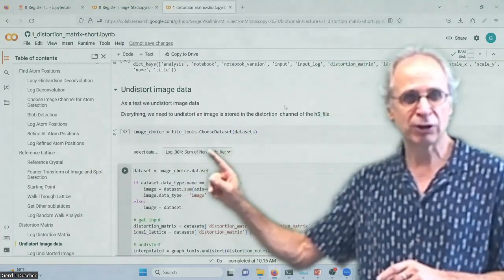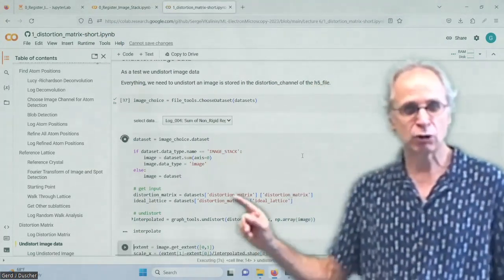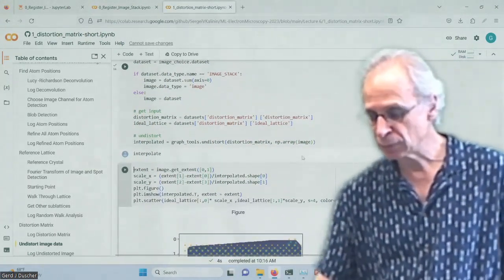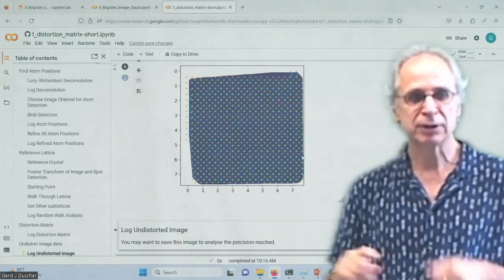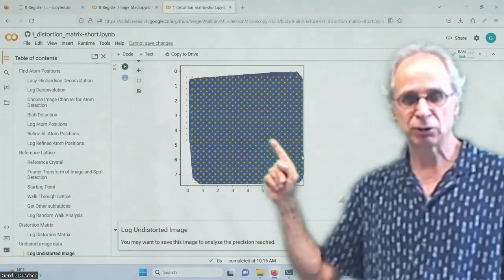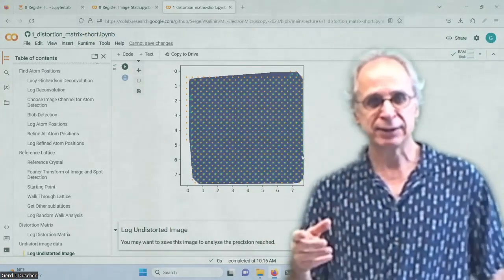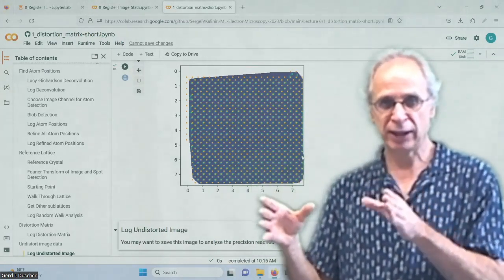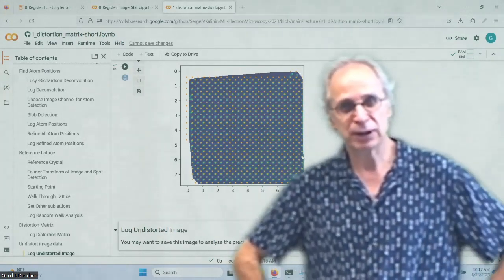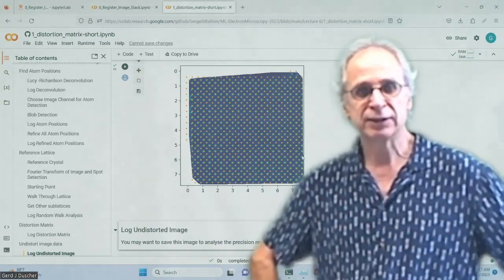We use the image that we just had, right, in the deformation matrix. And we interpolate that. So SciPy spatial has an interpolation. And then we can run the extent. And this is now the perfectly undistorted image. And the same distortion matrix you can now use on any of the other non-rigid registered data sets that you have, at least from the same week, from similar specimen, and so on. So depending on your microscope or the microscope you're looking at, this is what you can do.